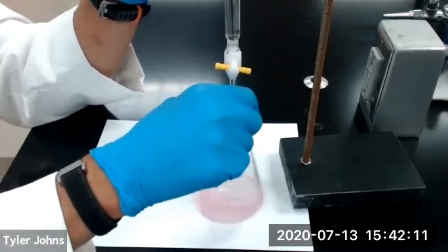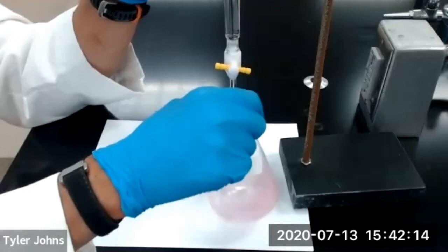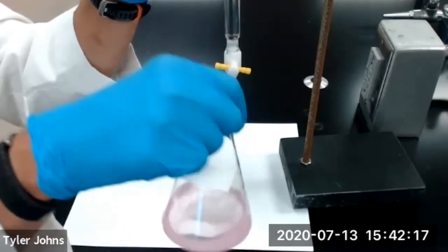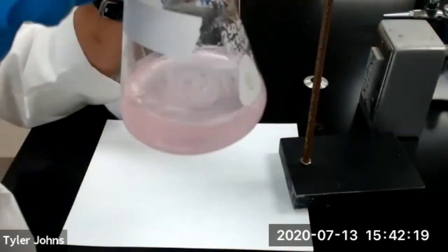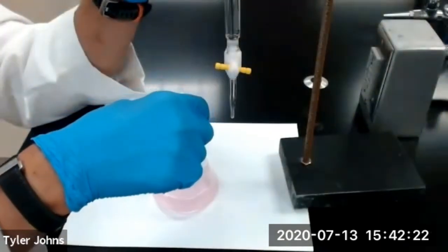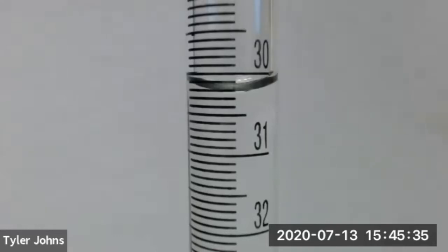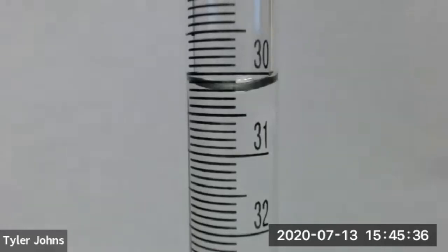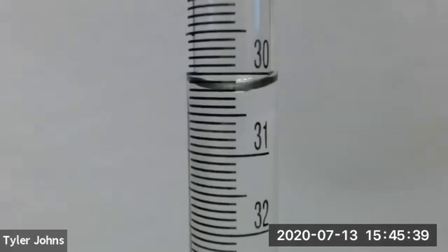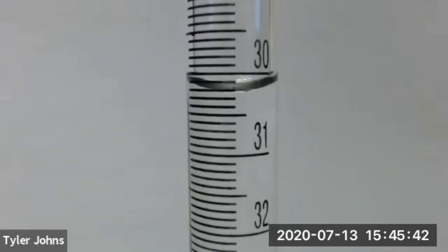We now have a pink color that is persisting after 30 seconds of swirling, so we have reached the end point of titration number two. This is the final burette reading upon the completion of the titration of the second half of our vitamin C tablet, or titration number two.